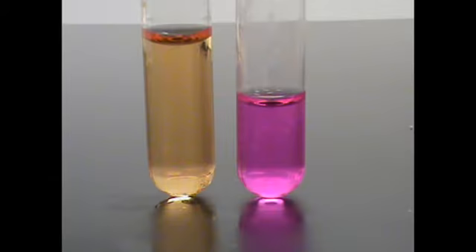Interpretation of the urease test results. On the left is a negative urease and on the right is a positive. The organism on the right was capable of breaking down urea and producing enough alkaline waste products in a 24-hour period to overcome the phosphate buffer in the media.